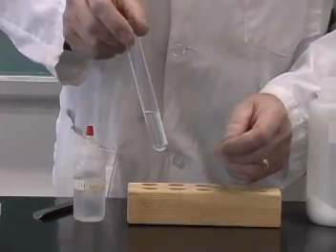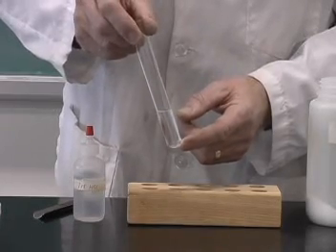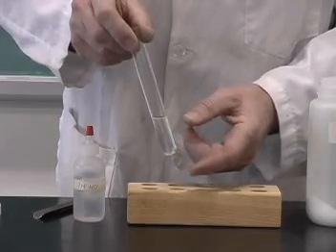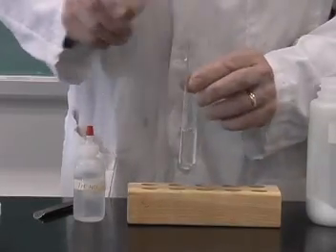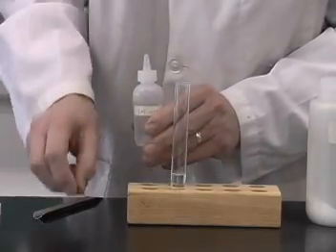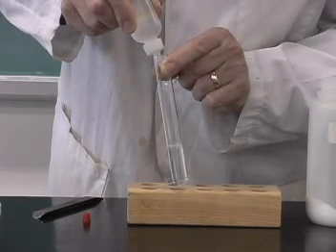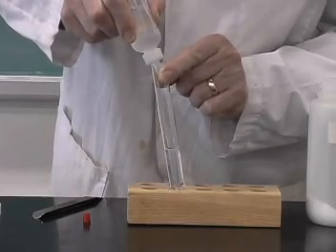All that I'm doing here is dissolving the sodium bicarbonate in the water. So this is really a physical change, much the same as when you dissolve some sugar in your tea or coffee, or sugar in water. Now I'll take some hydrochloric acid. I've got some 1 molar hydrochloric acid here, and we'll add some of that to this solution. You notice that as soon as I add that, we have lots of bubbles being formed.